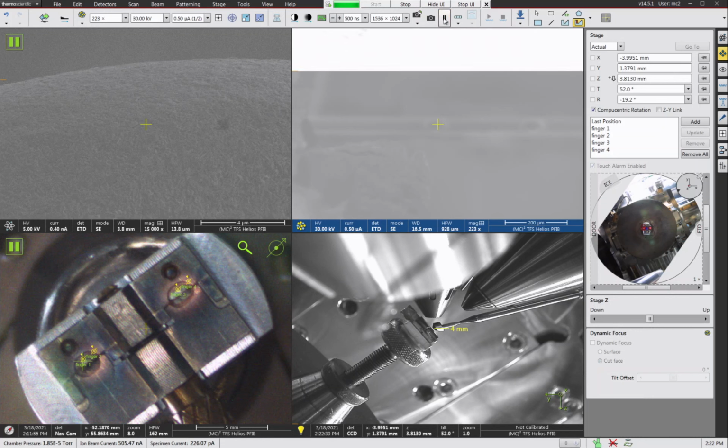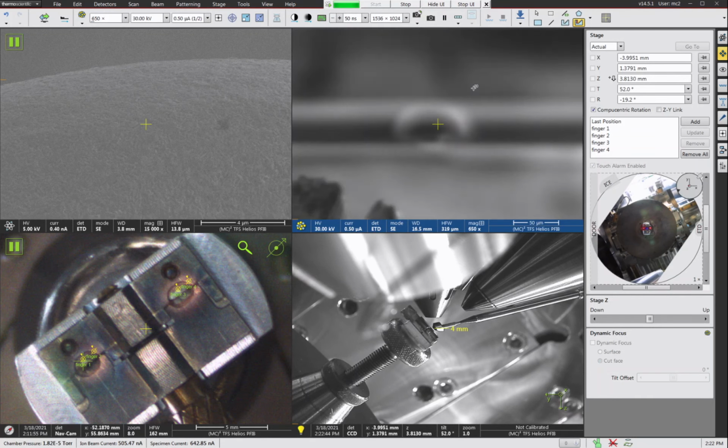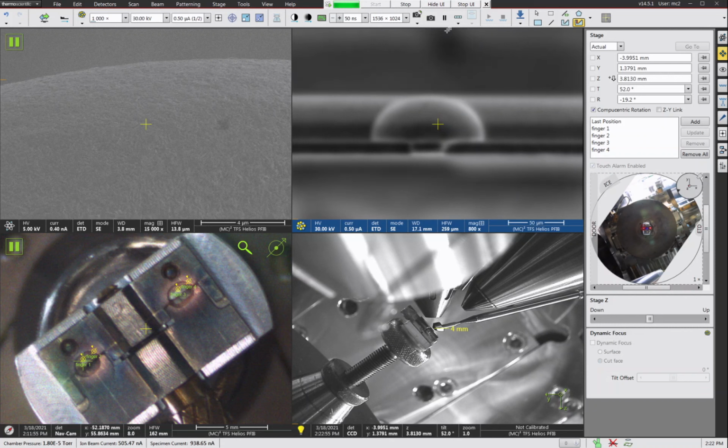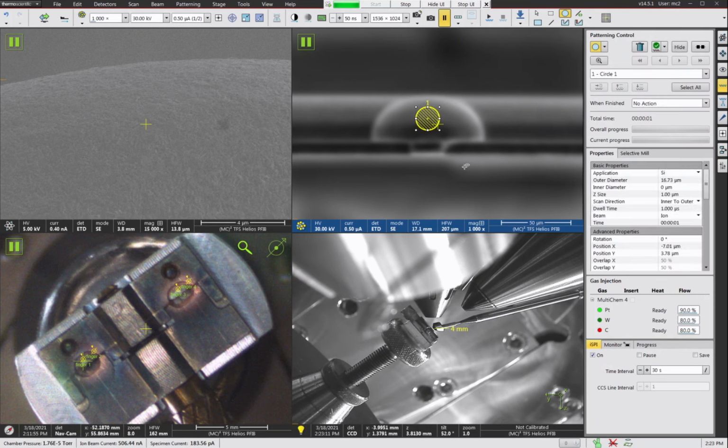Now what we want to do is try to get our focus as reasonable as we can. These big beams are kind of hard to focus, and hopefully your system, or if you come to use our PFIB, it'll be a little better aligned on the day you use it, but this is all we're looking for, just kind of rough focus of the system. Now, we want to draw a pattern on top of here that will leave a circle behind in the center. So we would do a circle in the middle.